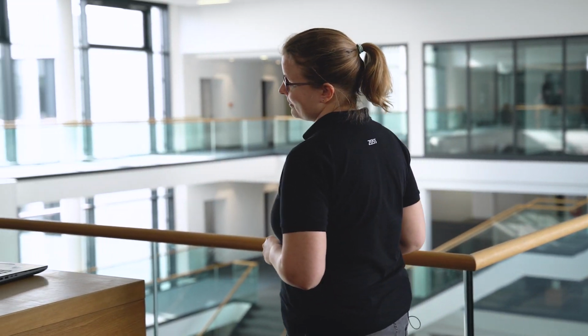Hi, I'm Svenja, and I'd like to give you some tips all around the new Multiview in Zeiss Inspect X-Ray. It has a lot of small features to use it in a smart and intuitive way. I'd like to show you some of them that you may not know and that sometimes make your life easier.